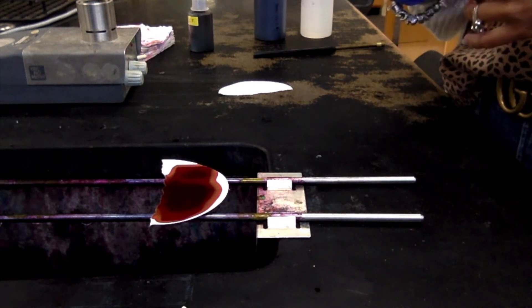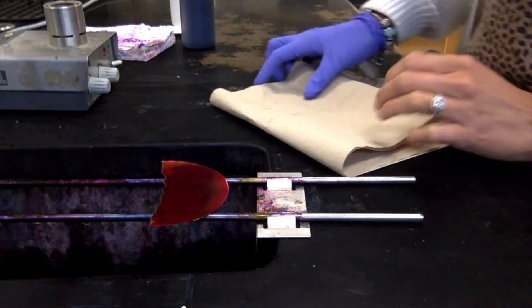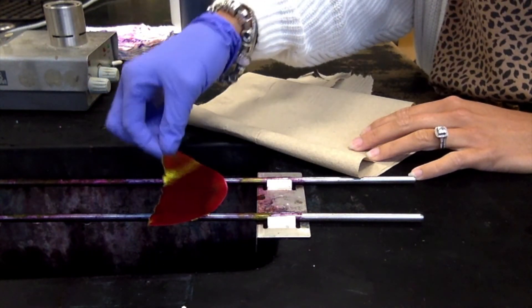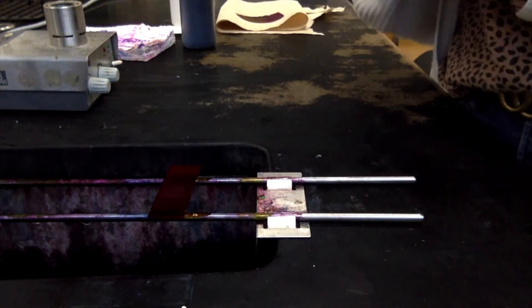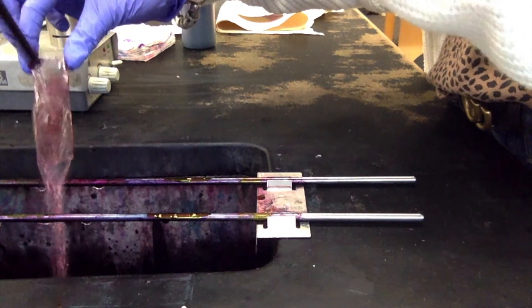I've let the carbolfuchsin sit for six minutes. I'm going to take the filter paper off and dispose of it in the biohazard container. Now we've got a nice bright magenta colored slide. We're going to rinse the carbolfuchsin off so we can see our smear, since there's a lot of carbolfuchsin on there.